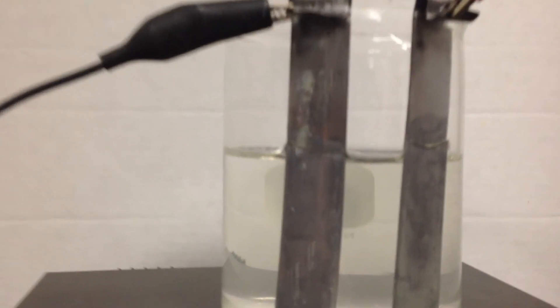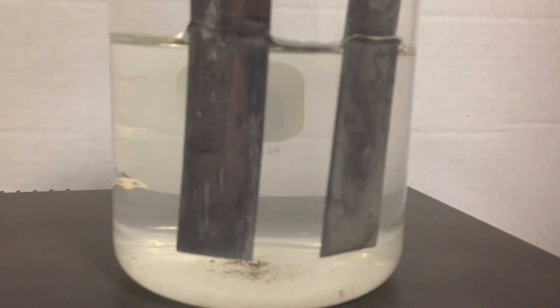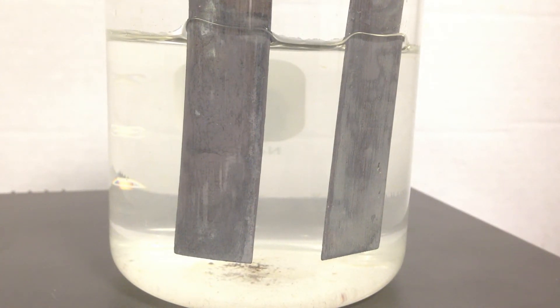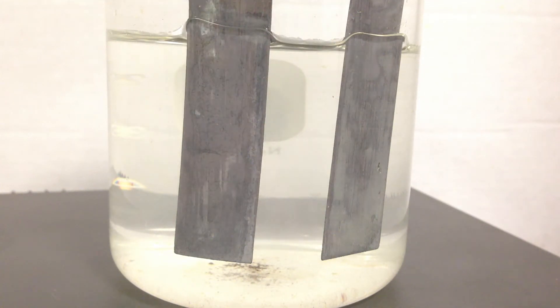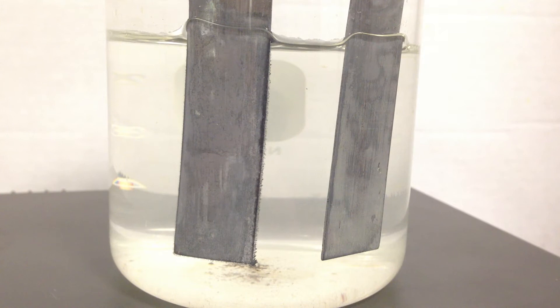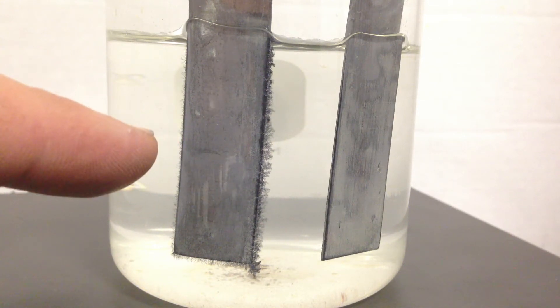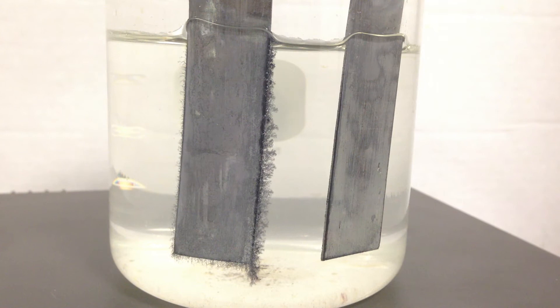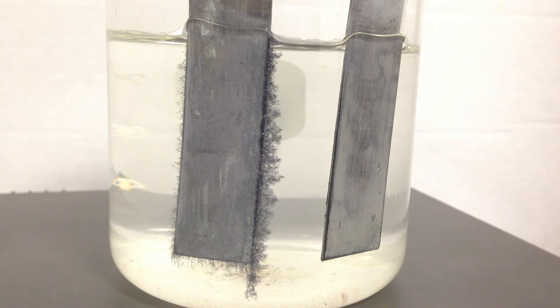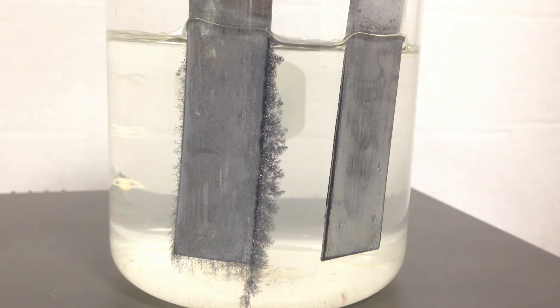Let's get up close and see what's going to happen. I'm turning on the current now. The cathode — the electrode attached to the anode of the battery — should get bigger. We should be seeing reduction taking place, and as you can see, the cathode is indeed getting bigger. Solid lead is crystallizing: lead²⁺ ions are becoming lead⁰ solid. We have rudimentary plating going on.